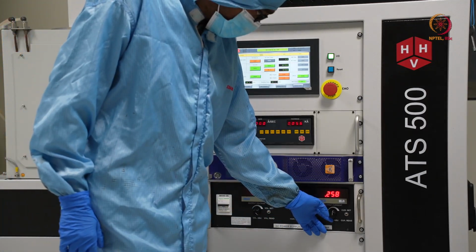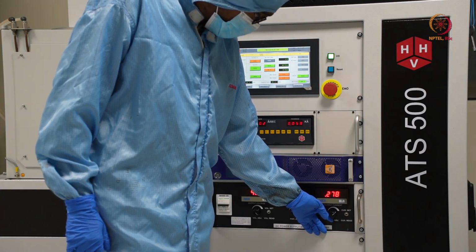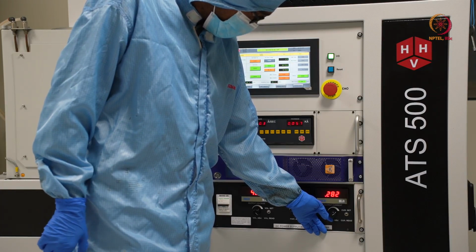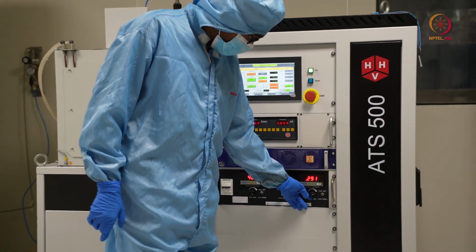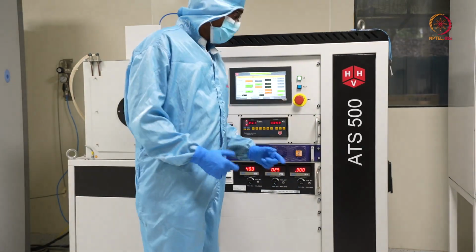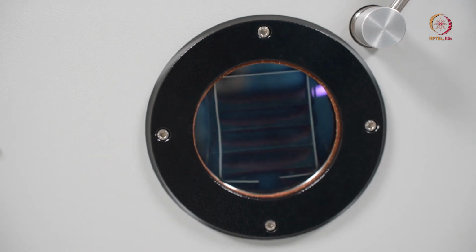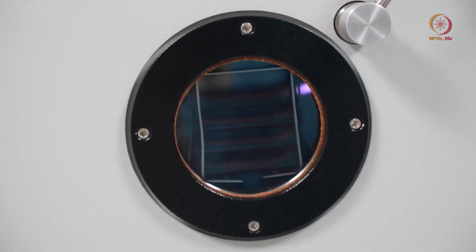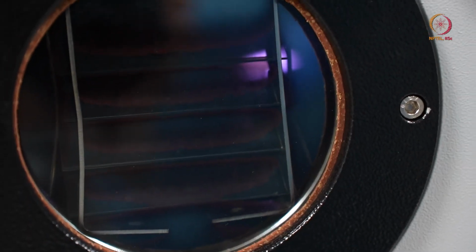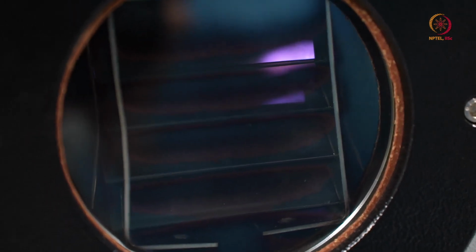So till now we have delivered enough power here, so that much is enough for generating plasma, and plasma is generated here also. So we'll just focus in the chamber and we'll show that plasma is generated. We can show it from here. So here through the viewport you can see, if you can go a little closer, see the plasma is visible, but you can also see that it is actually stopped by the cover there. So that is our shutter.